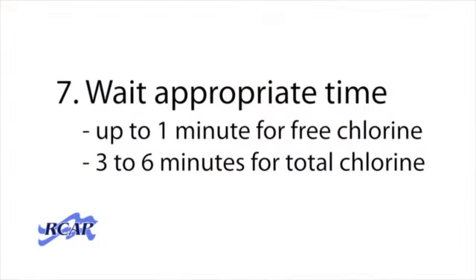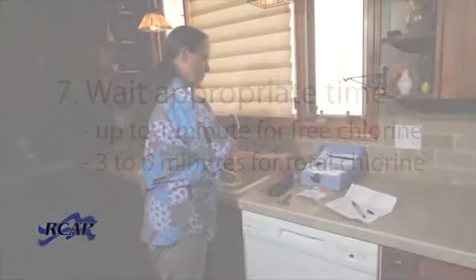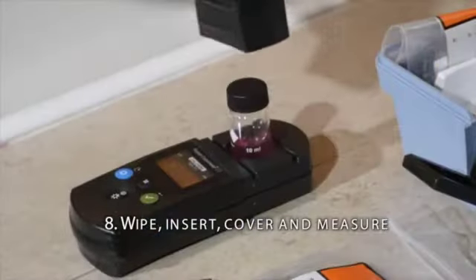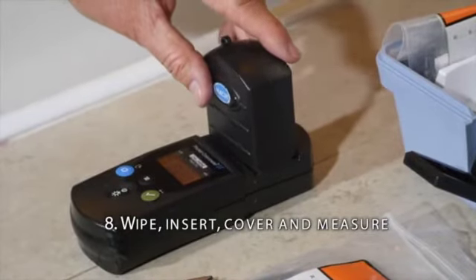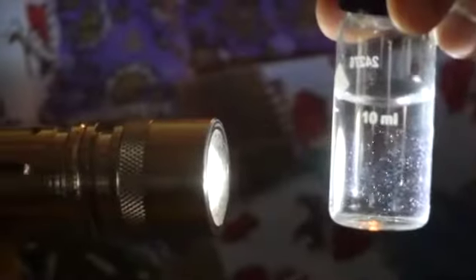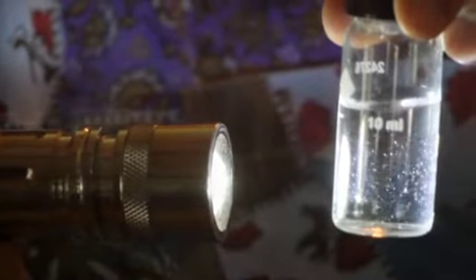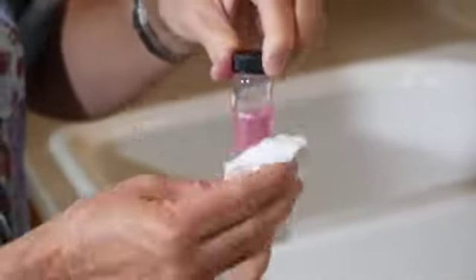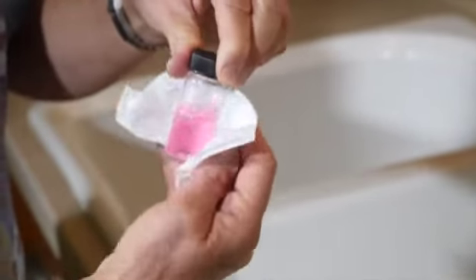For free chlorine, measure the sample within 1 minute. For total chlorine, you need to wait 3 to 6 minutes. Then the procedures are the same. To measure, wipe off the vial, line up the diamond, cover, and click Measure. Remember that fingerprints, air bubbles, and fog can change the result. So make sure that you wipe off the vial with a clean, lint-free rag.